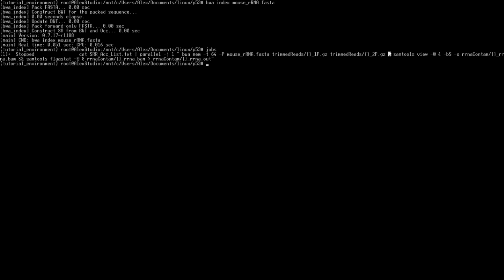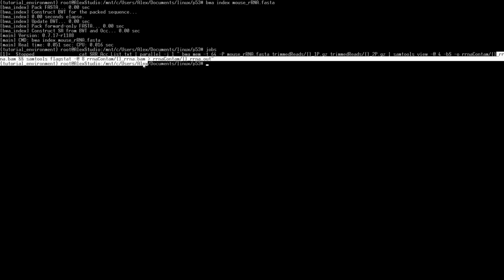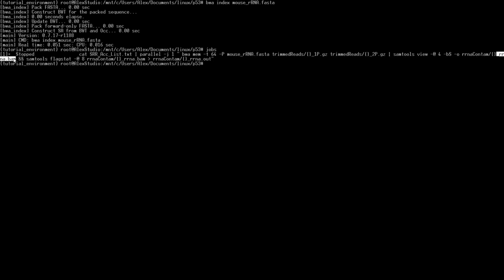After that, we can pipe the results of this. So what BWA mem is going to create is a .sam file. So with STAR, we created the BAM file. This will create a SAM file. And instead of writing our SAM file, since it's going to be really big, we can pipe that directly into SAMtools view. So view is a sub program of the SAMtools package, and we'll write that right to a BAM file. That'll save a lot of space on our hard drive when we start running.